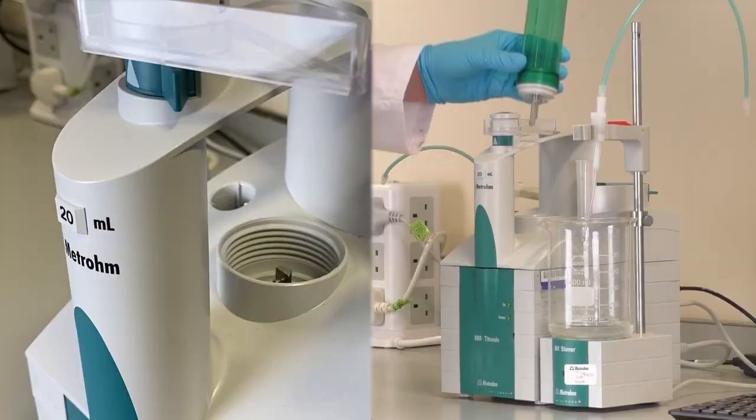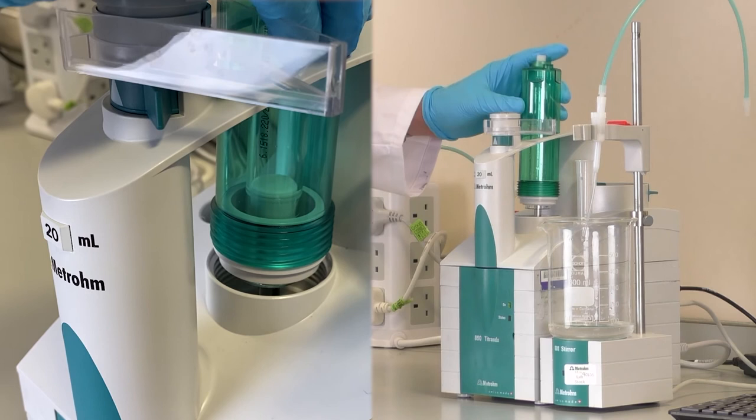Hook the cylinder unit onto the piston rod, then push down gently and screw it in clockwise to secure.